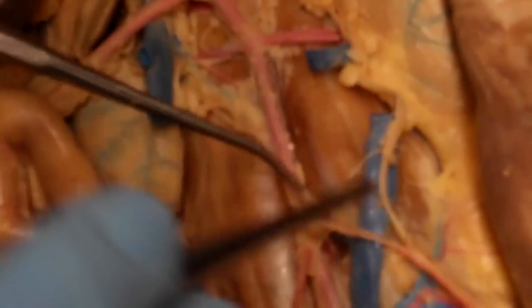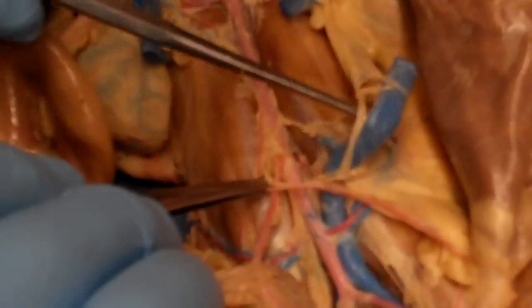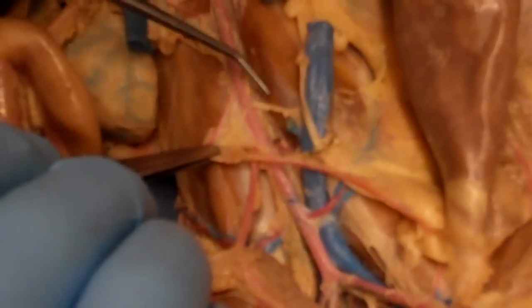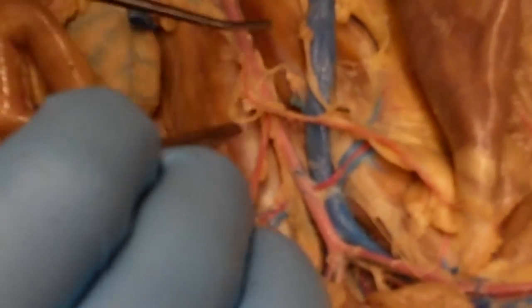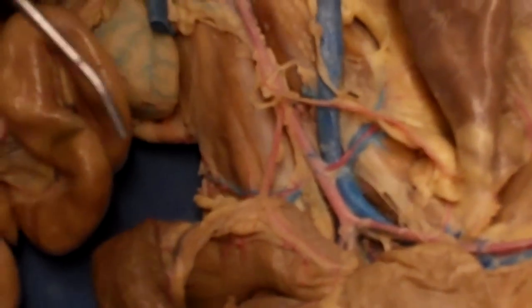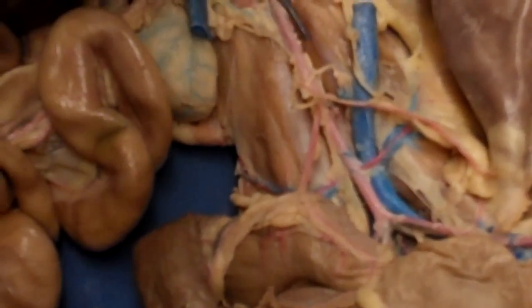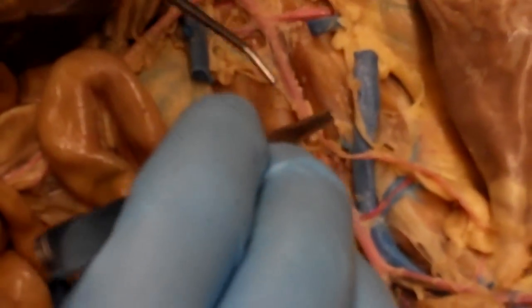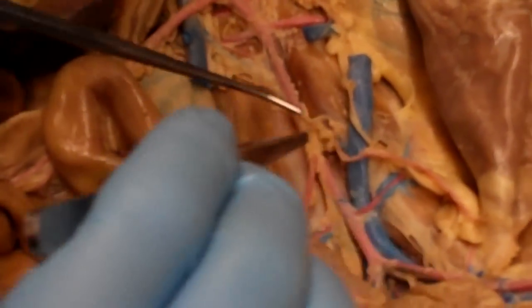If we follow a little farther down, this one is going to be more subtle, but there's an artery right here, and the other one may be lost. That may be the remnant of it right there. But that's going to be the gonadal arteries, or I think they use gonadal. Basically, in a male, it'll be either the testicular arteries, or in the females, it'll be the ovarian arteries. In this cat, it's a male, so this would be one of the testicular arteries. But again, there's two testicles, two ovaries. They should be paired structures.